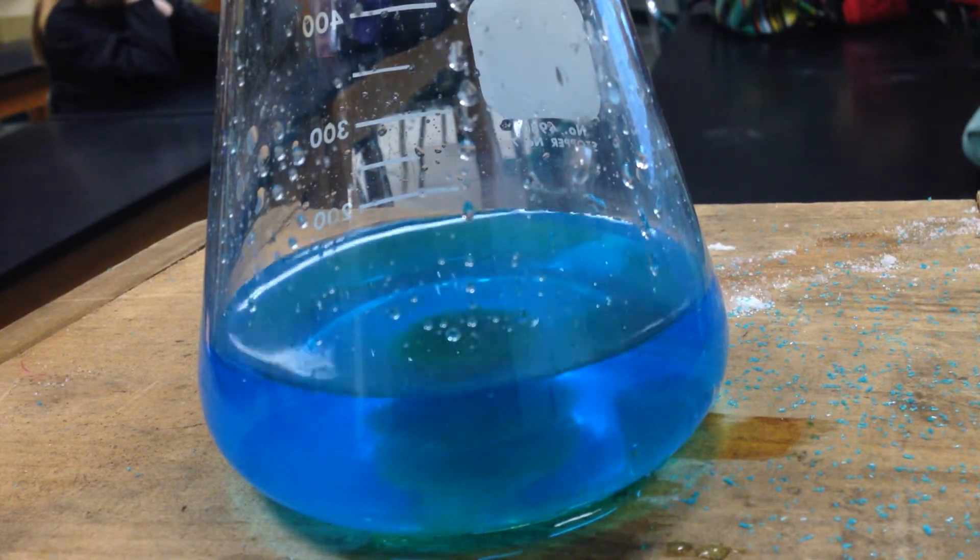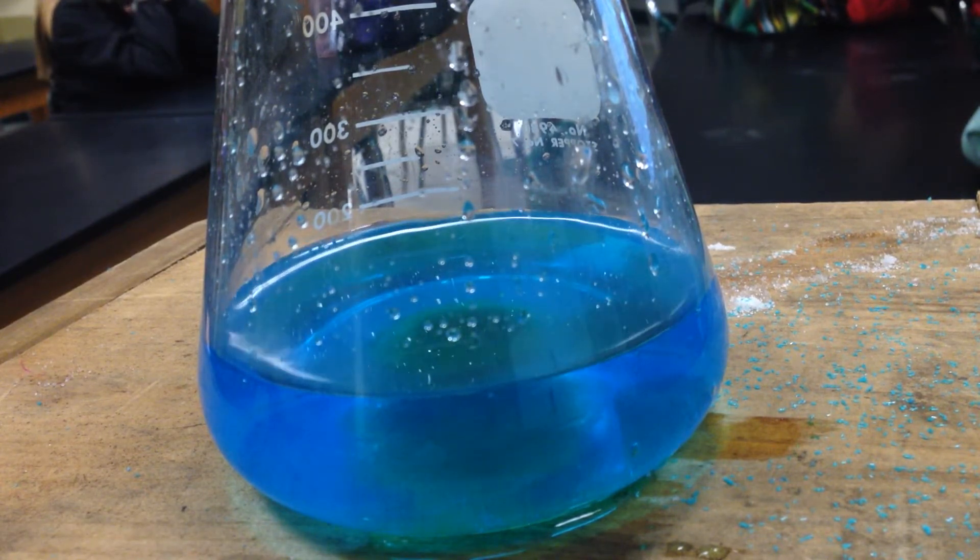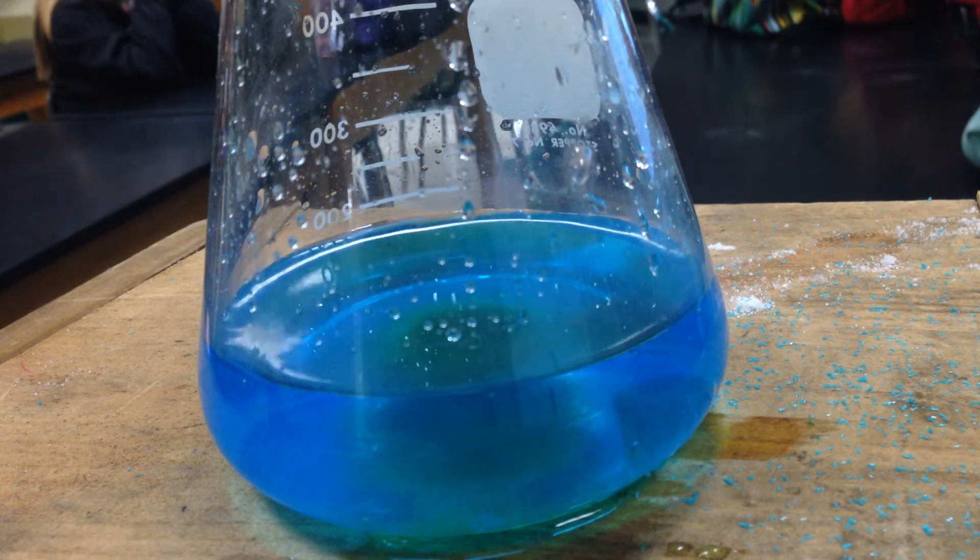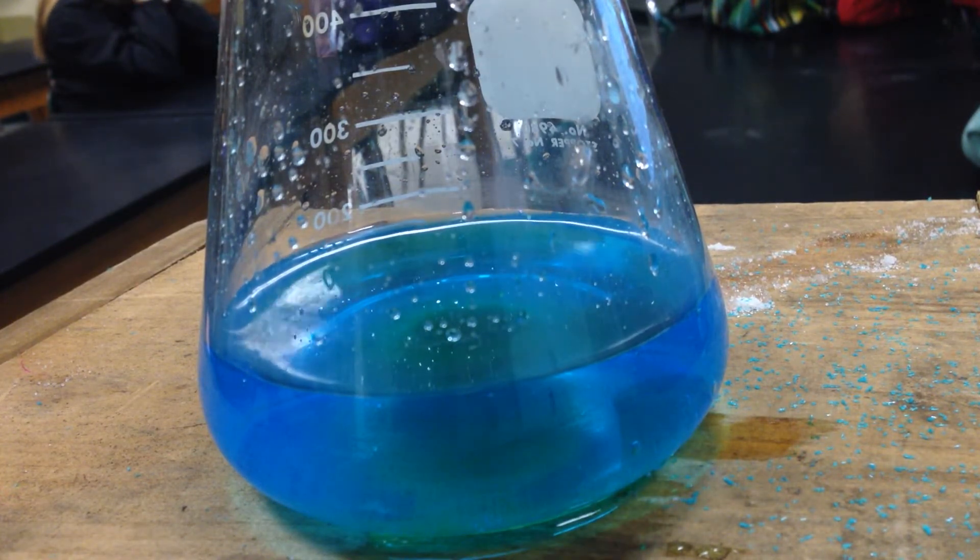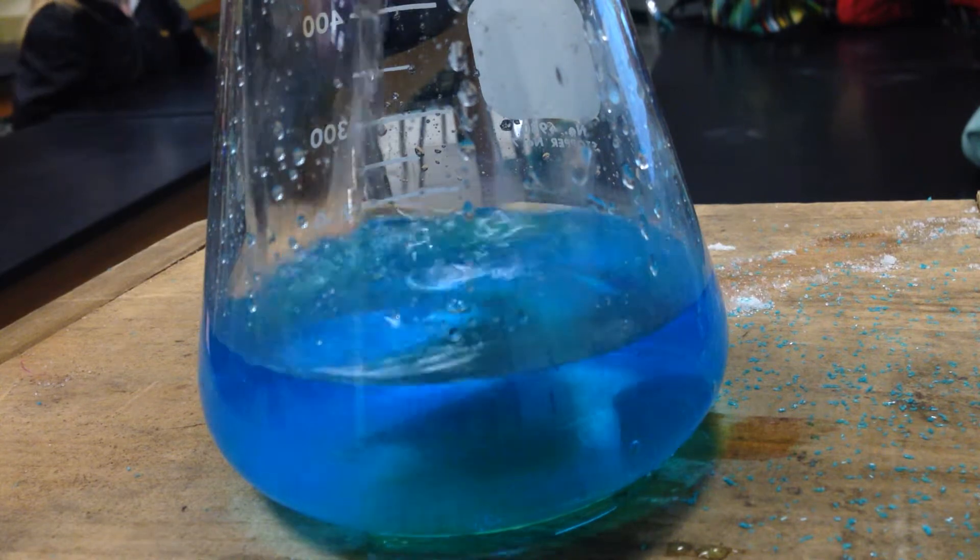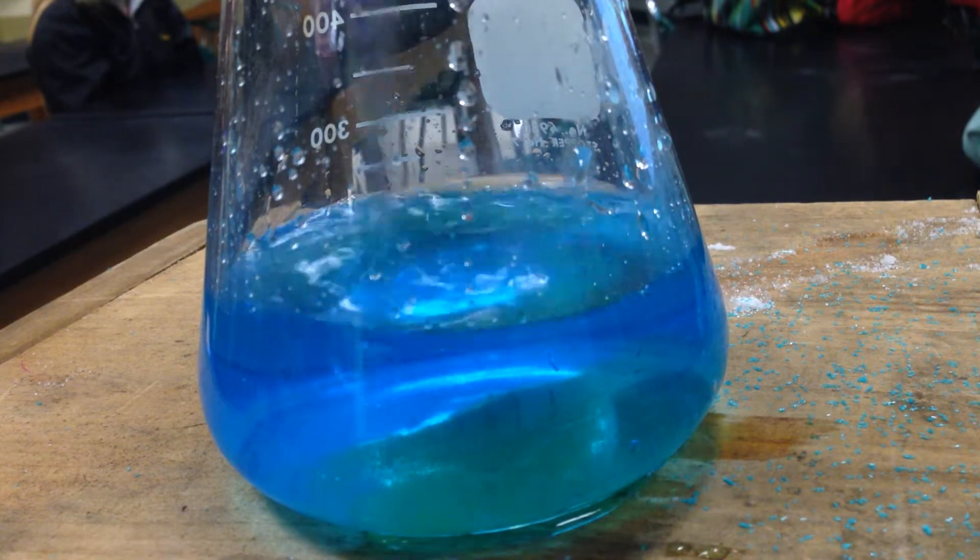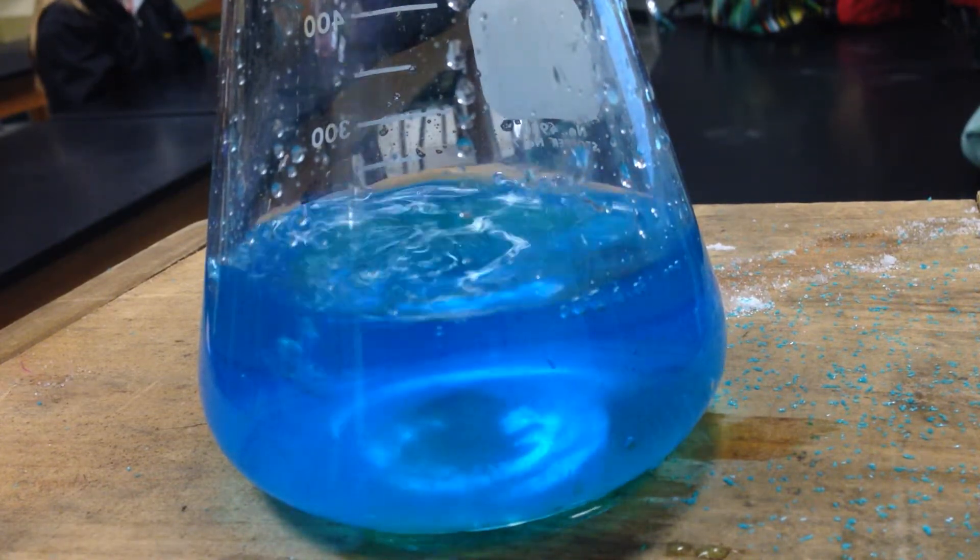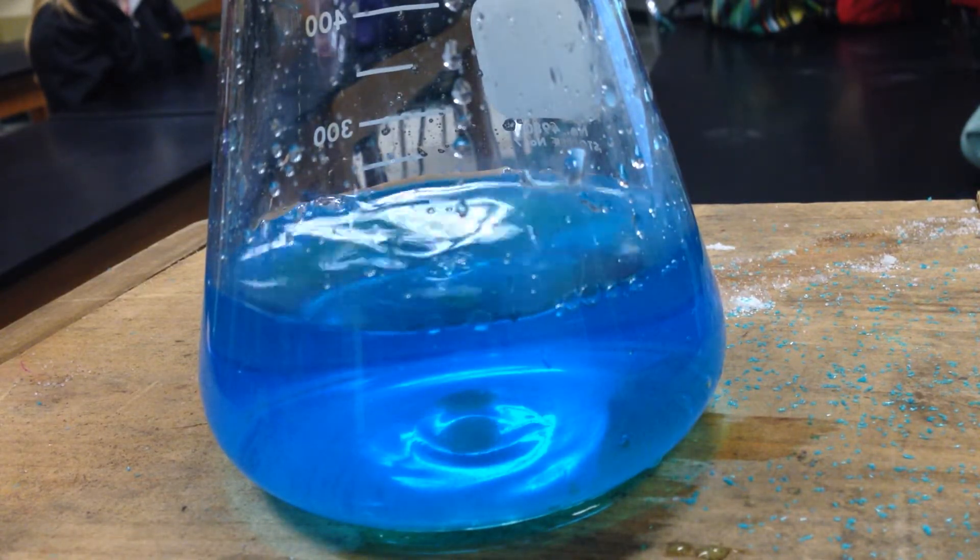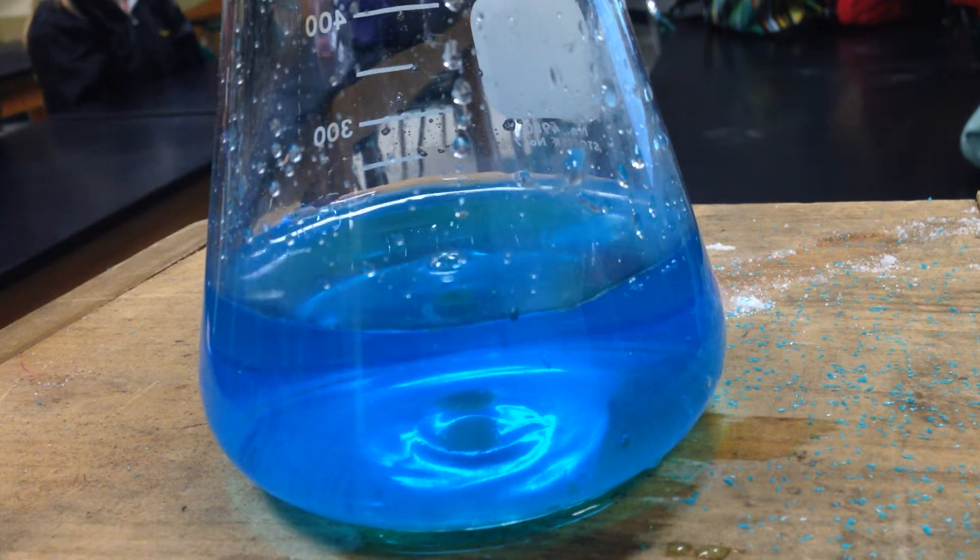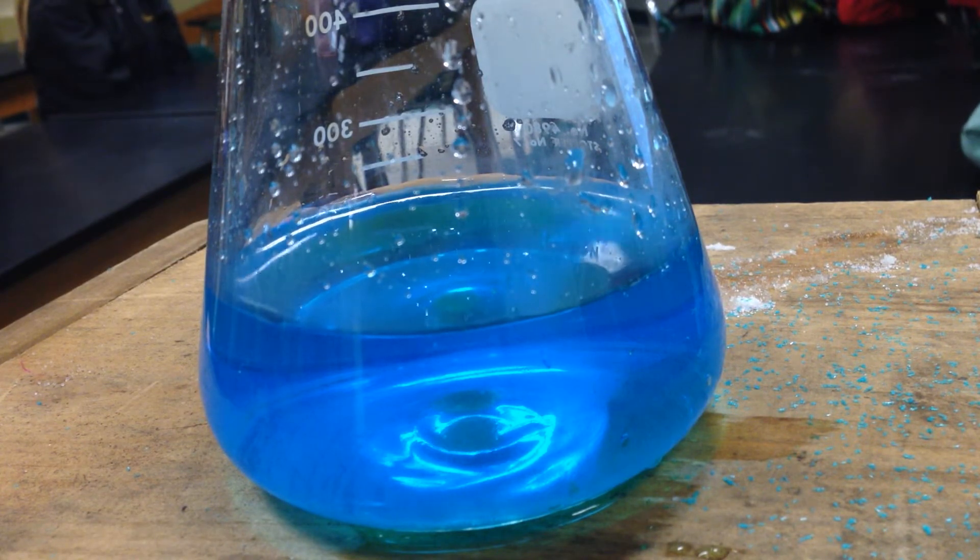The hydrate had a certain color because it was the oxygen that was penetrating the d-orbitals. By me adding water and releasing some of the ions, which are the chloride ions, the chloride ions acted differently. There's still some chloride ions in here. And I can dissolve all of those ions here, and we can get that nice blue-green color. Now, so we saw two color changes. We had copper chloride as chlorine ions as the ligand, splitting the d-orbitals, and now we have the water.